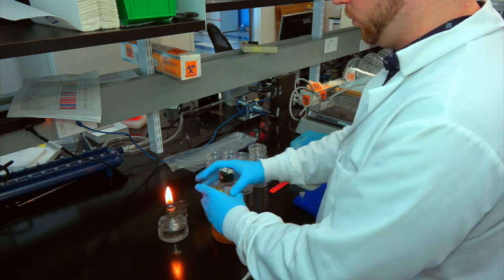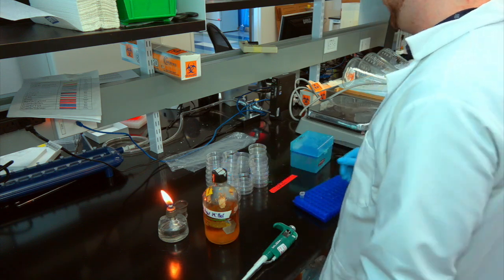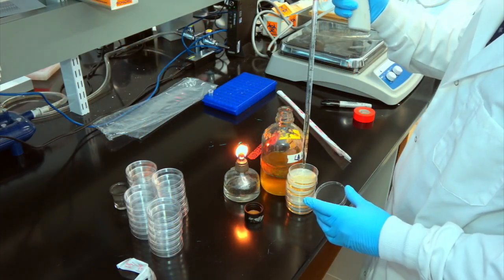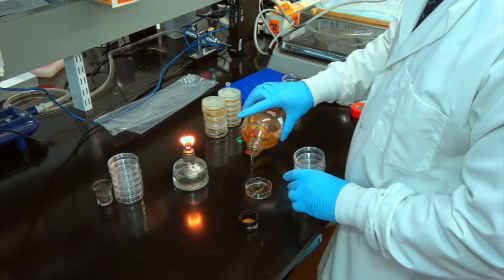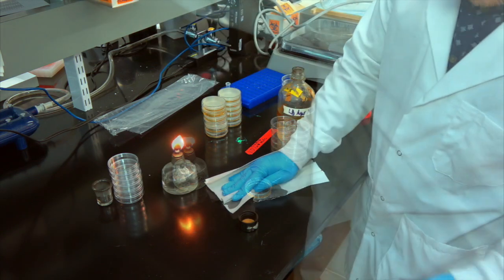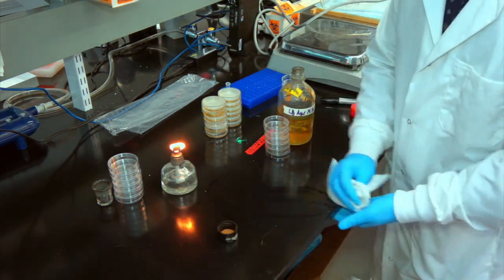It's usually faster, easier, and more sterile to pour the molten gel mix straight from the bottle. However, it's good practice to measure out the first couple of plates using a sterile pipette until you get a good feel for the appropriate volume. Don't worry if you overfill or spill a little. That's why we made 220 milliliters of LB agar instead of 200. You'll get the hang of it, and before you know it, you'll be a plate pouring pro.